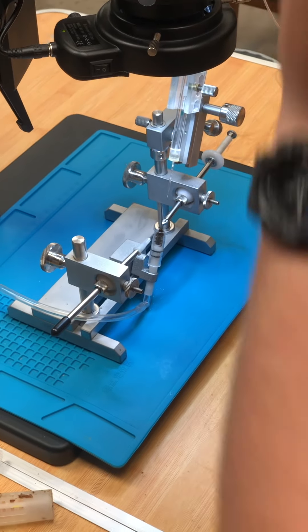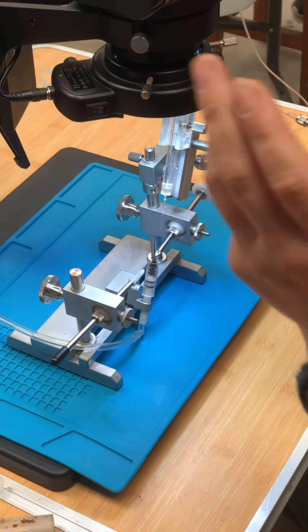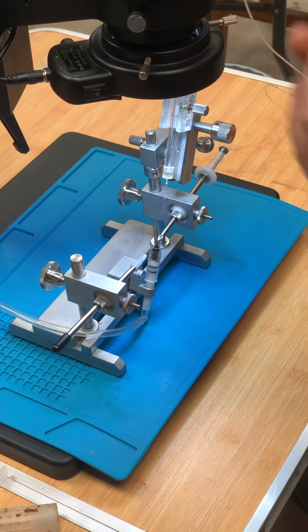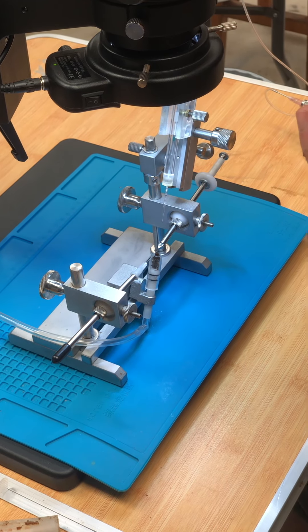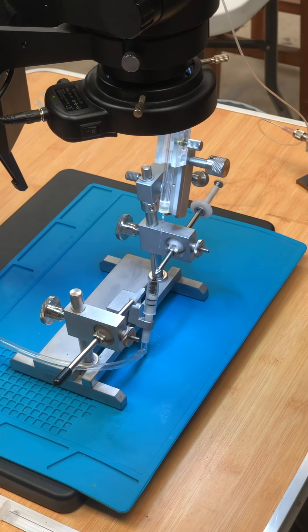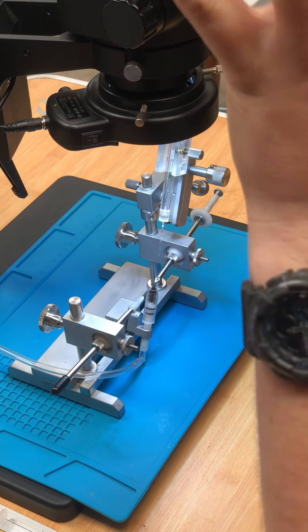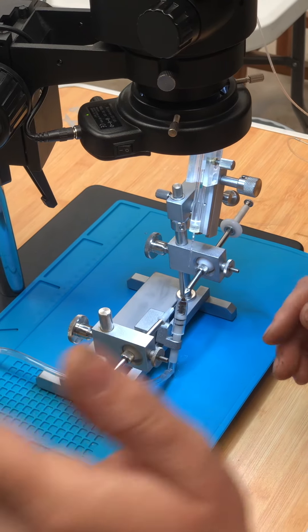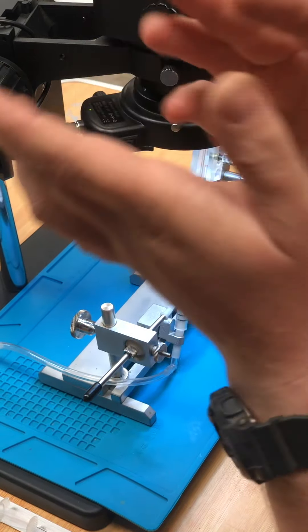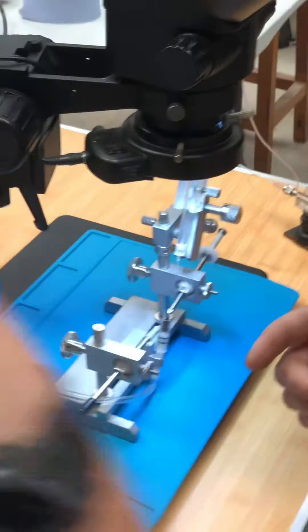So you've grabbed it? I've grabbed it now. It's not always nice and simple like that. Sometimes the sting sheaths will be either side — two parts of flesh that surround the sting. The queen sting is unlike the worker sting: it's got a few more protective structures and no barbs. It's not designed for massive combat but for smooth operation. You've got the central part of the sting and two parts that slide downwards, all smooth and enclosed as a single unit, and around it are two bits of flesh that close in and help keep the sting clean and safe. Sometimes you'll grab hold of those, and you'll know because they move in an elastic manner, as opposed to the sting, which is quite rigid.